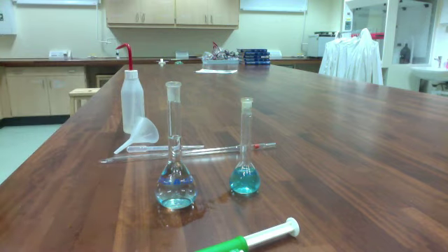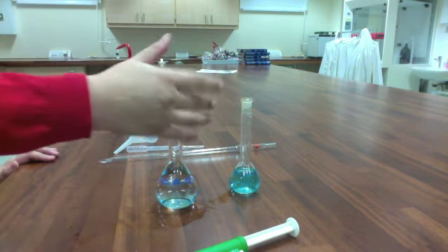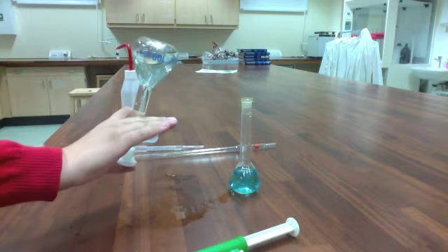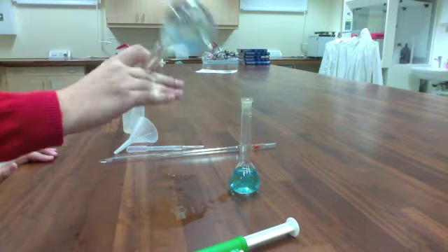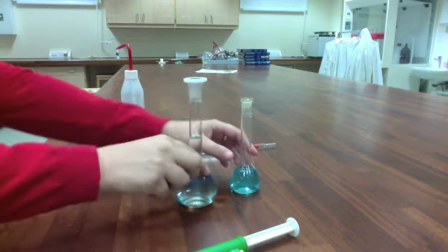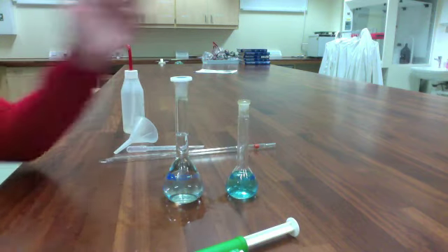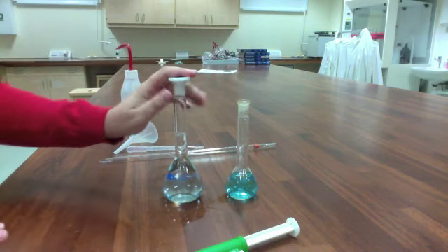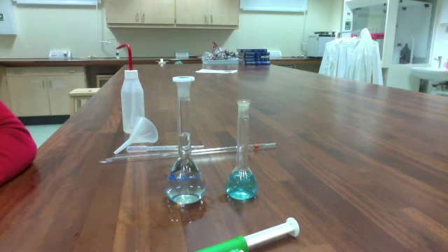The bottom of the meniscus is level with the mark. Put the cap on. Invert a couple of times to make sure it's properly mixed. And there we go. So there are our two solutions: one prepped from a solid, and one prepped by dilution.